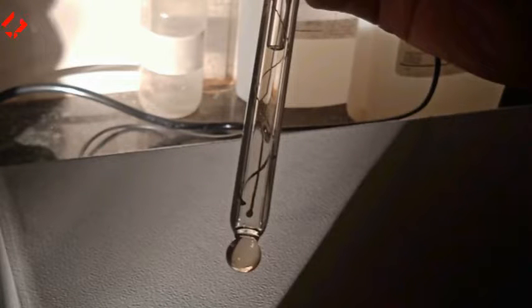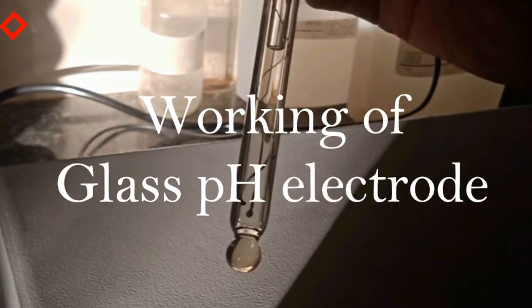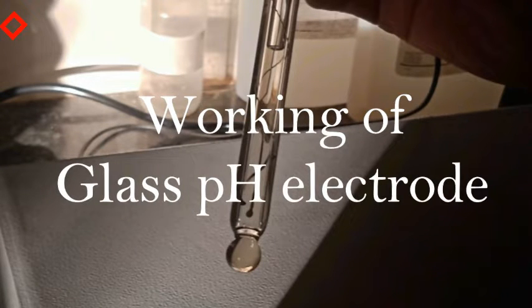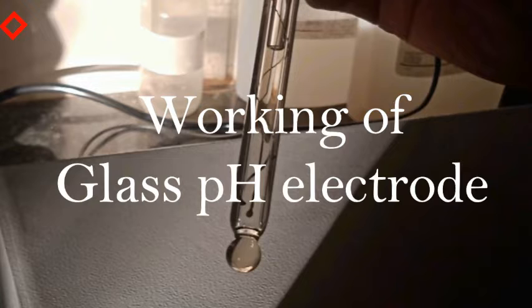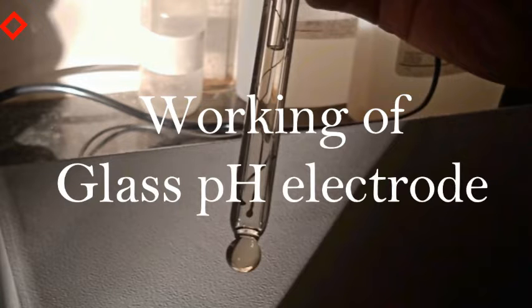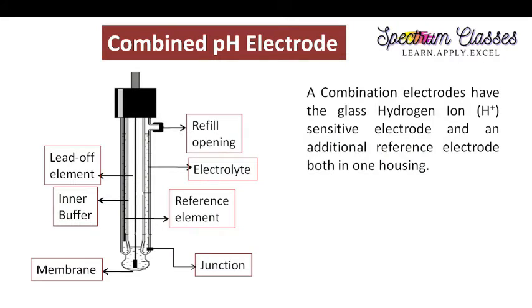Welcome back to Spectrum Classes. Today in this video I am going to show you the working of the glass pH electrode and its concept.